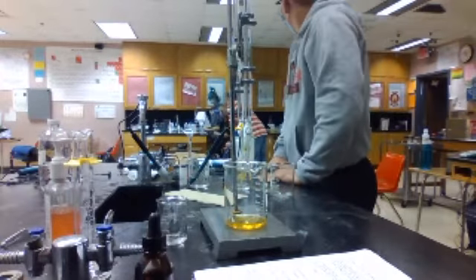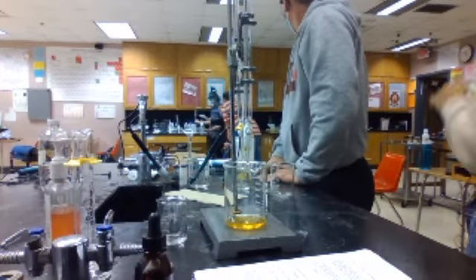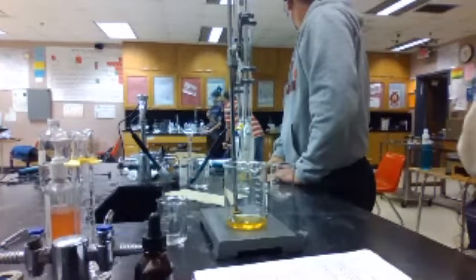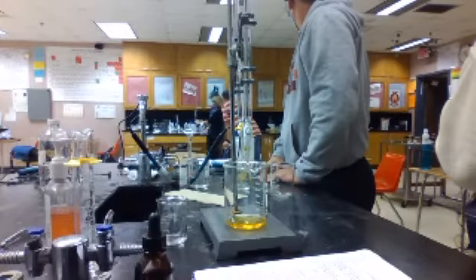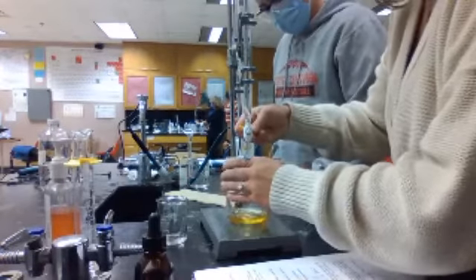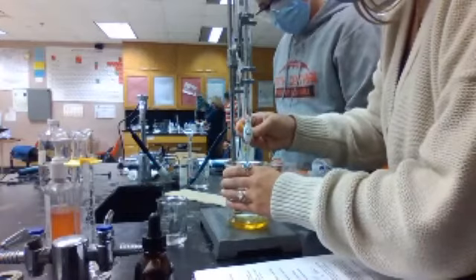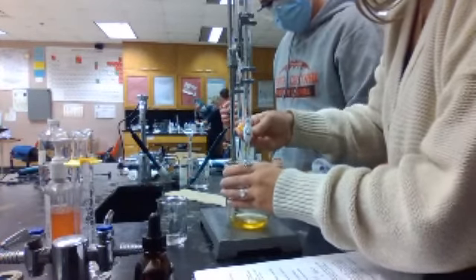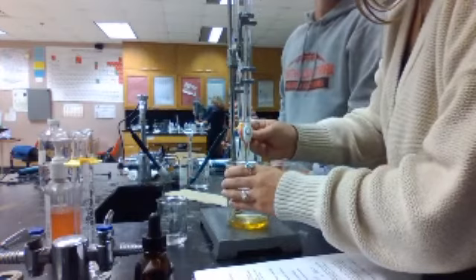Well, we get the initial base. And then, how long should it stay blue until we stop dropping? It just turns all blue, because when it's hitting it, it should be yellow. Yeah, and then it'll just start to turn blue. It's hard to tell. You watch the volume, you can be like, oh, I'm gonna drop this. It's like two under that volume as well.